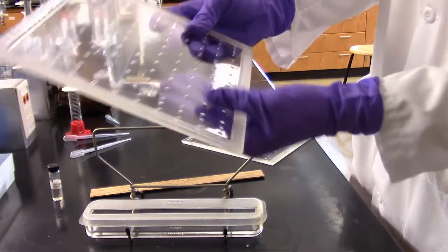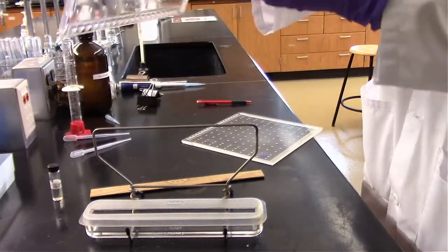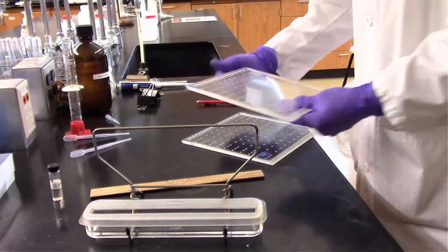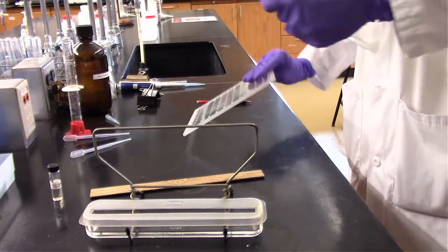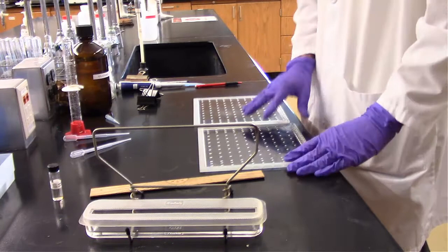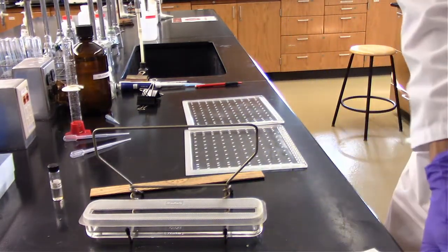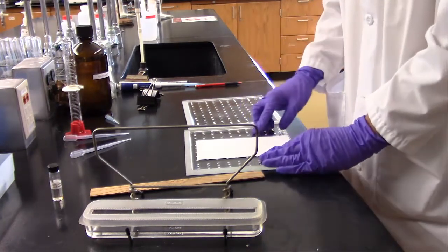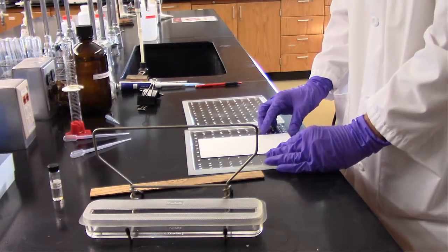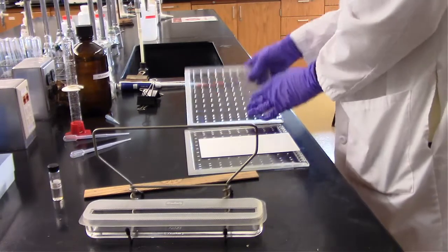This is textured on the inside, so we want to make sure that the inside that is textured is pressing against the plate. That way the solvent doesn't run up against the flat glass faster than it runs up the plate. So we can make sure our 2 textured sides are facing in. We can now put our plate right here. We spotted everything very high, so we didn't need to worry about having our spots dissolve in the solvent, which is convenient.